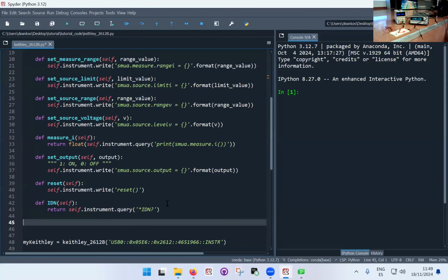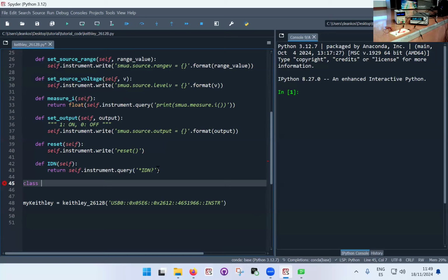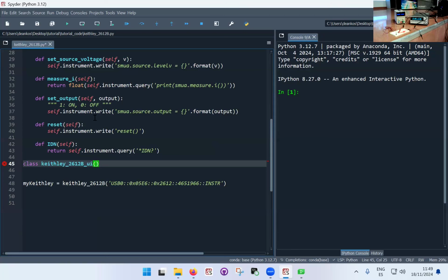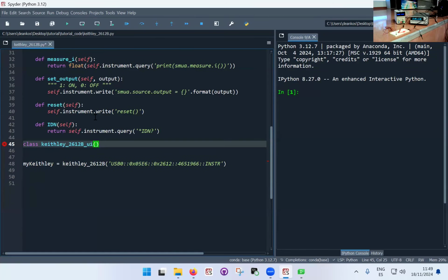So I'm going to go here and write class. I'm going to call it Keithley, same as before, 2612B_ui. Now, in this particular case, the Keithley was an instrument of its own. There's nothing else that it needs to, as we say in programming, inherit from other classes. But here in these brackets in Python, what you have to put is any other class that you inherit from. Inheritance in object-oriented programming is just a way to say that a certain class belongs to a certain other, more general class. And because this is an interface, I want this class to belong to the class of all Qt interfaces, specifically widgets. It's a little bit of a technicality, so you just follow along.